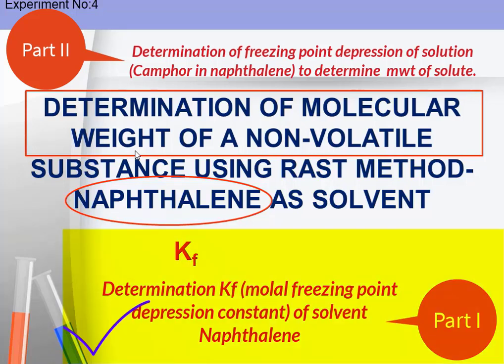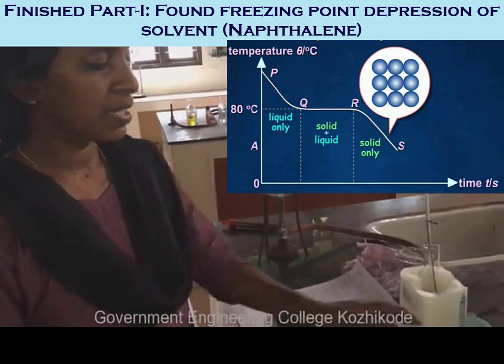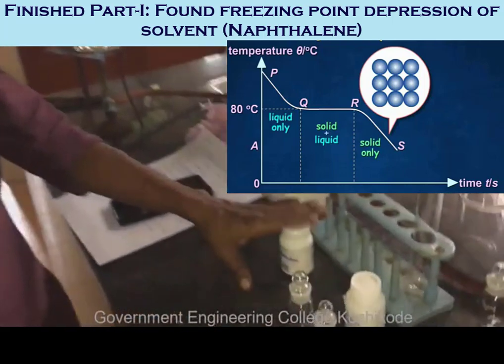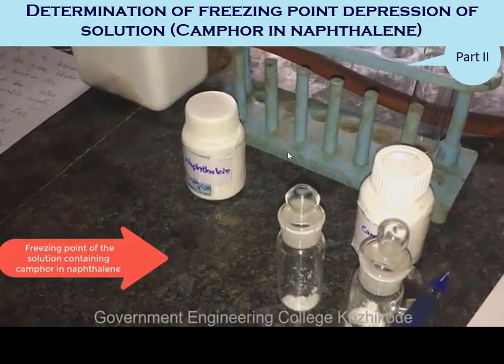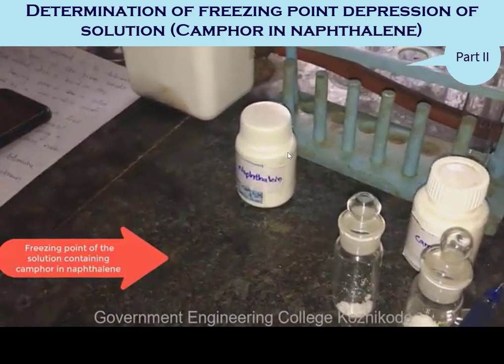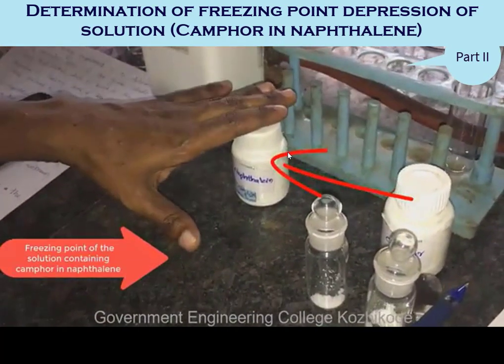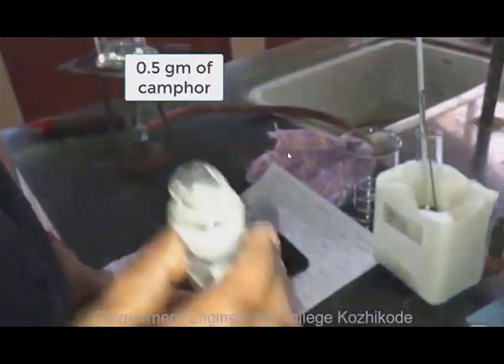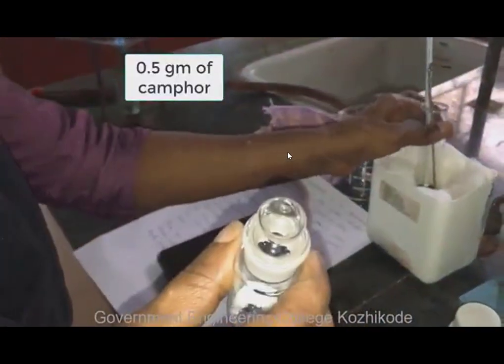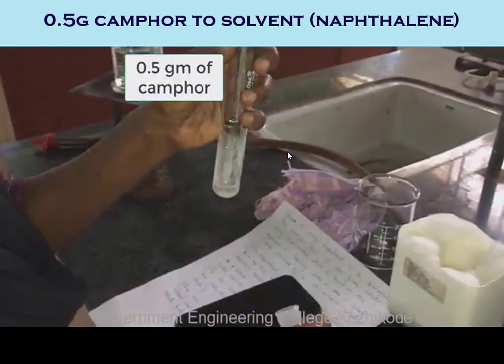We have found out the melting point or freezing point of the pure solvent naphthalene. Now we have to find out the freezing point of the solution containing camphor in naphthalene. For that, accurately weigh about 0.5 gram of camphor and transfer it into the solvent.